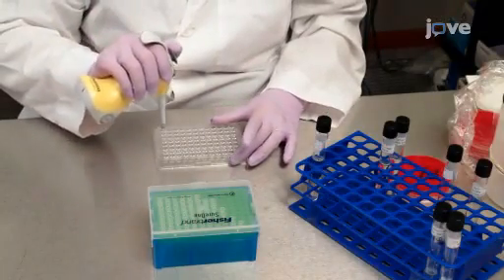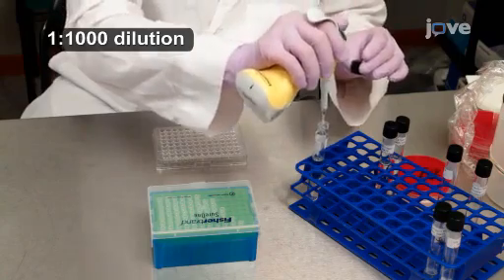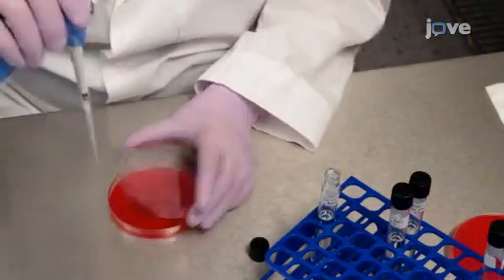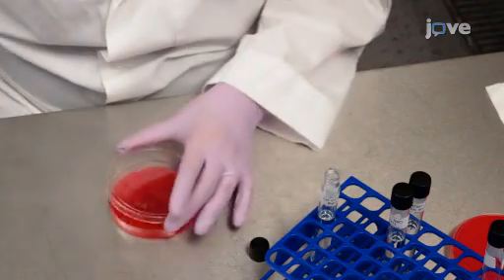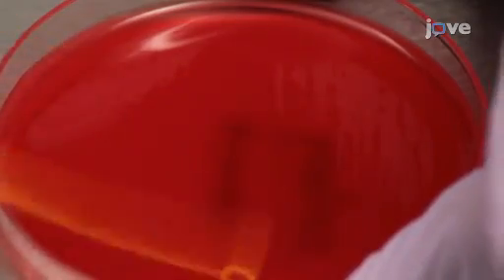In preparation for a colony count, use a single-channel pipette to transfer 10 microliters of the solution in the growth control well to 10 milliliters of saline. Mix and then transfer 100 microliters to a suitable non-selective agar medium such as trypticase soy agar with 5% sheep blood. Using a sterile loop, spread the solution over the entire agar surface. Repeat this process 2 times in different directions to assure even distribution of the inoculum.